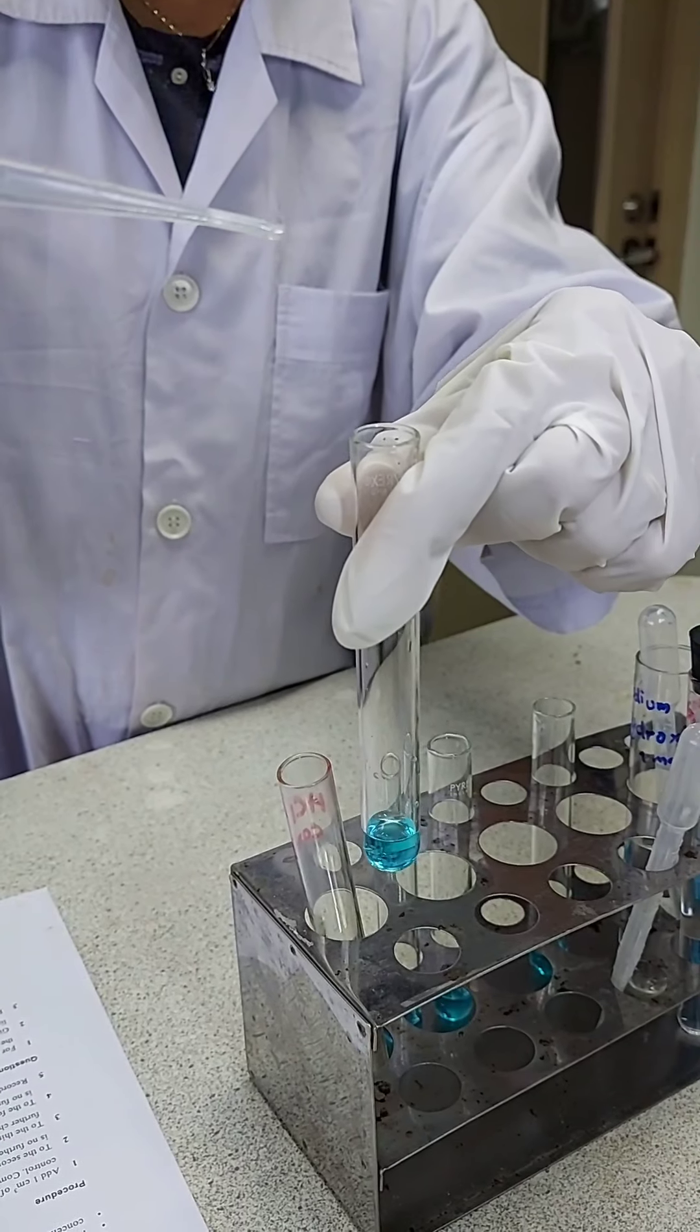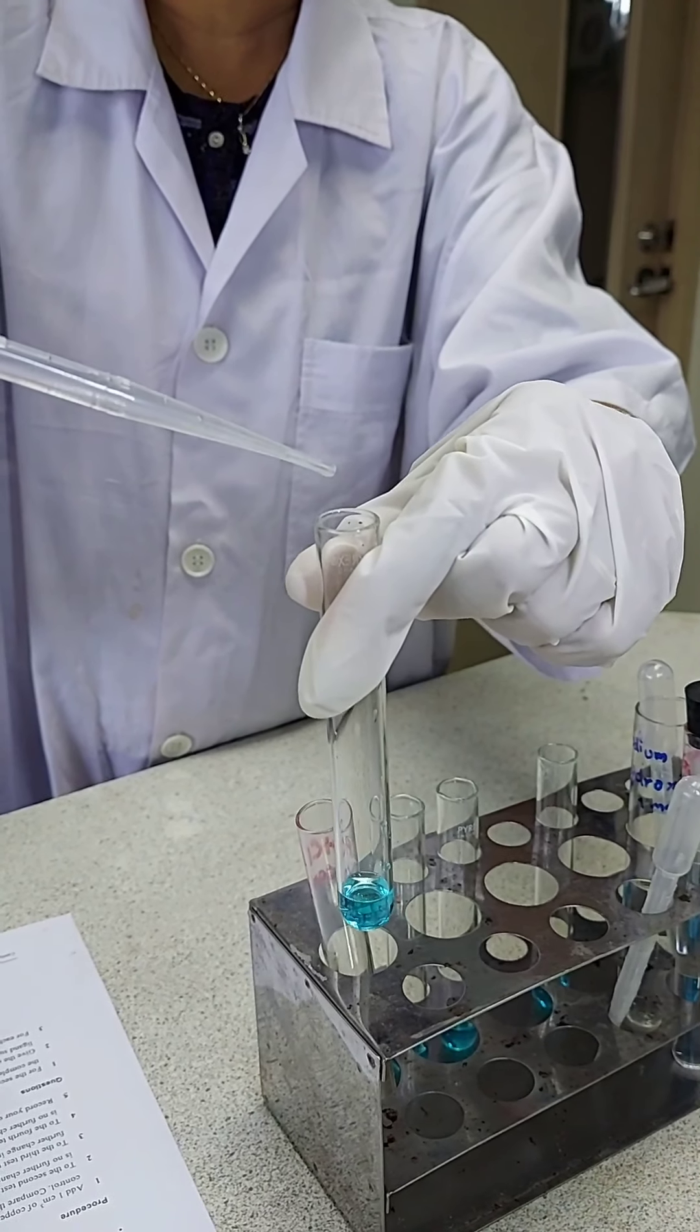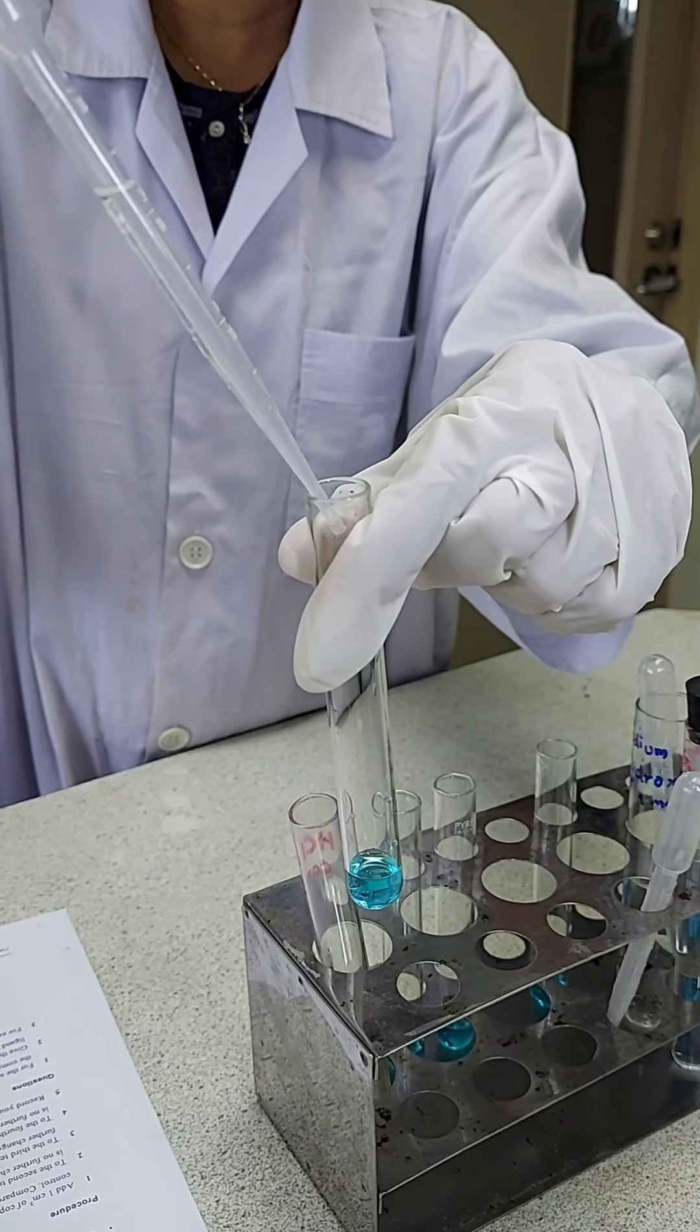It's fuming, the hydrochloric acid is concentrated so you can see the fumes of hydrogen chloride.